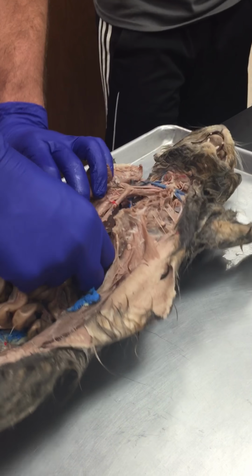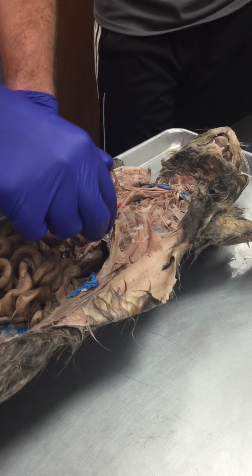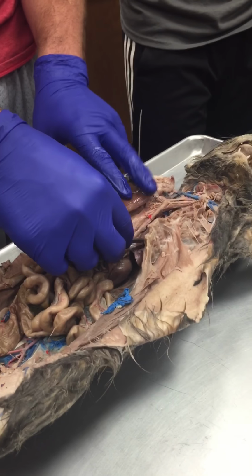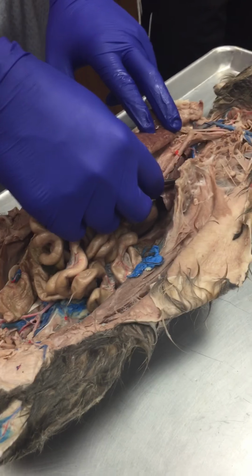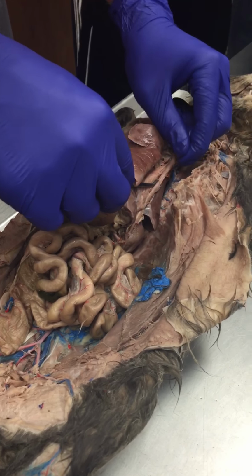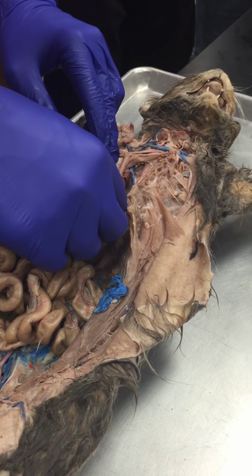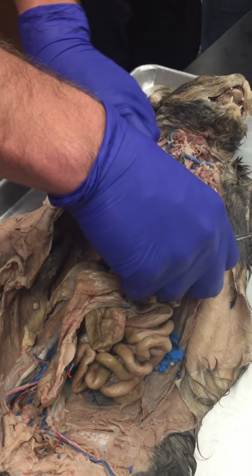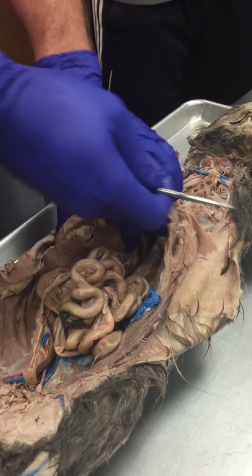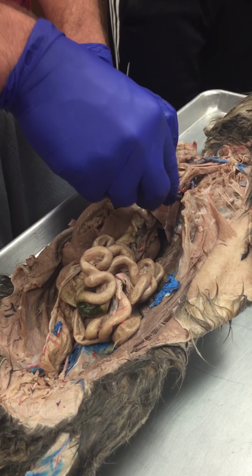So the aorta is going to run all the way down the whole body, so you can see it traveling all the way down. From here, we have these guys branching off. Most of them are broken. You should have seen these little red strings right here. Those are actually the intercostal arteries. So if you can see these little red strings that are sticking off, they look something like that. But they'll be attaching from the aorta to the intercostals. Maybe there's some on this side. Probably not. But that's what you'll see: these small red strings coming from the aorta going to the intercostal muscles.